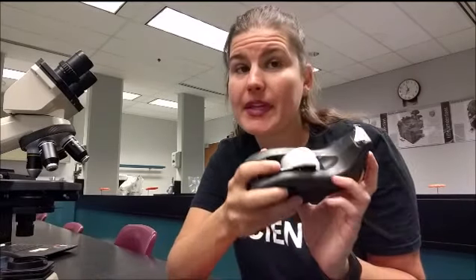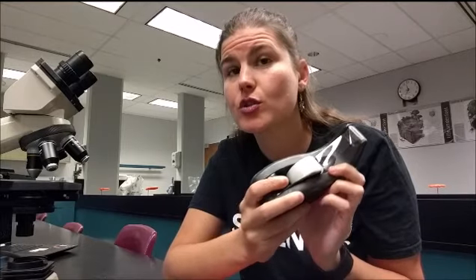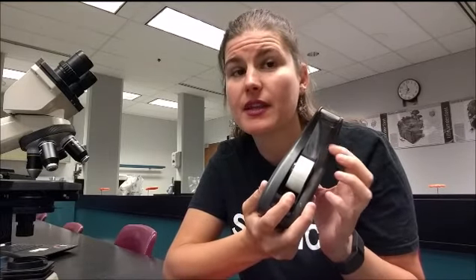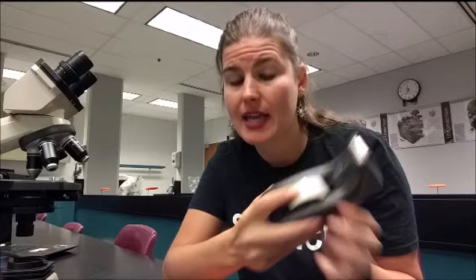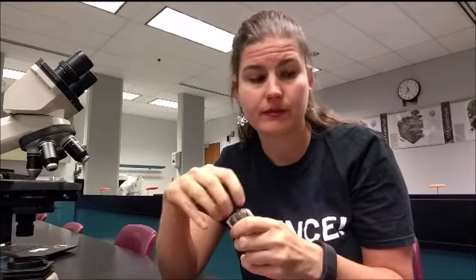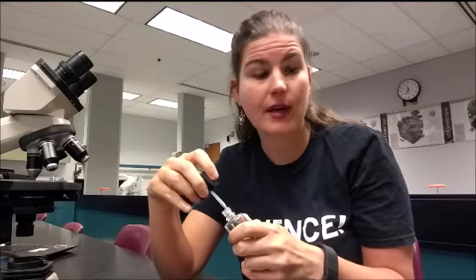You need gift wrapping tape, and this is really important because normal Scotch tape is frosted and you cannot see anything through it, so it has to be this really super clear gift wrapping tape. You need a slide, and you need a microscope. So what you're going to do is you're going to take a little bit of nail polish, and you're going to paint it on the underside of the leaf. And this is important because this underside of the leaf is where most of the stomata are.